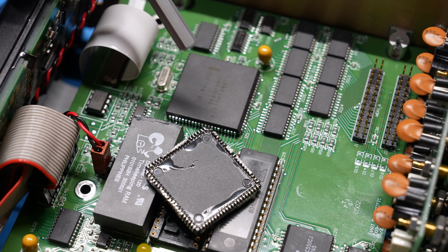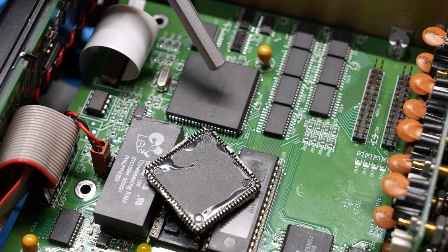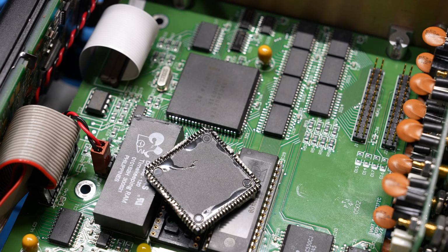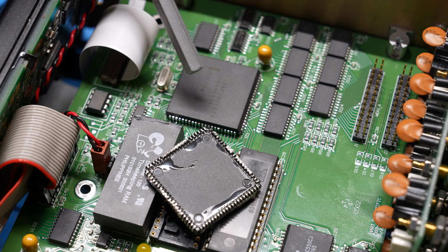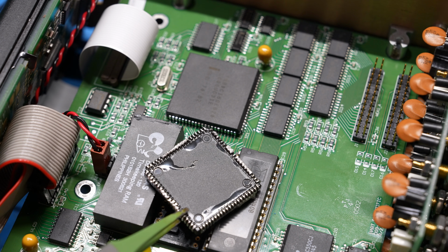And here we go. I went ahead and I replaced this. It's a little bit annoying to solder these because the pins are essentially under the package. And you have to be a bit patient, look at it from the angle, and make sure you're getting really every pin soldered and there are no shorts in between them. So I managed to do that. Here's the old part. So we're going to discard this one.